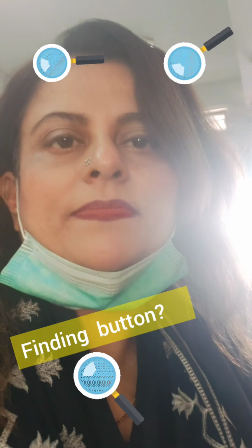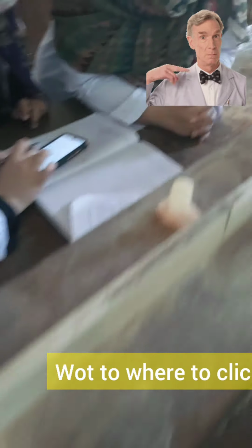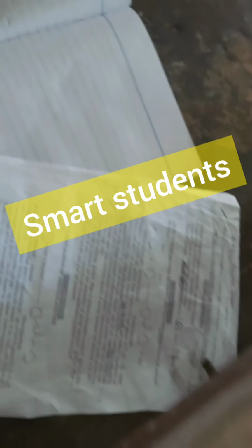I've just mentioned that my students are busy doing their calculations and their lab work, and they are near the fume hood, and some of them are doing the calculations. So I can show you the calculations. This is how they are doing the calculations. No problem, but you can continue. This is it. They are doing it.